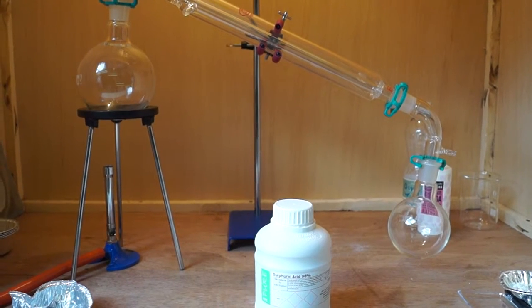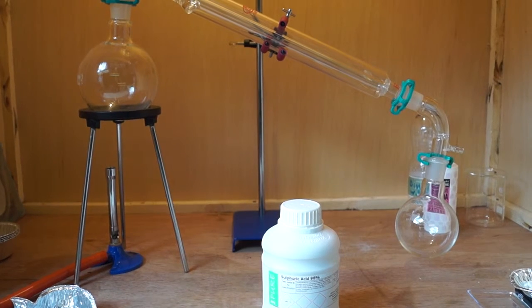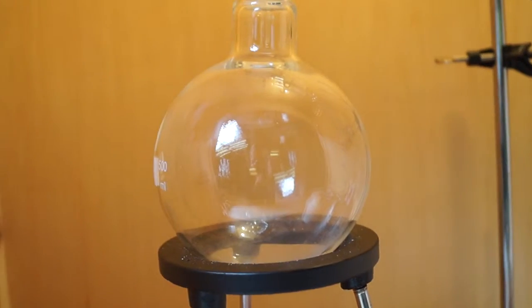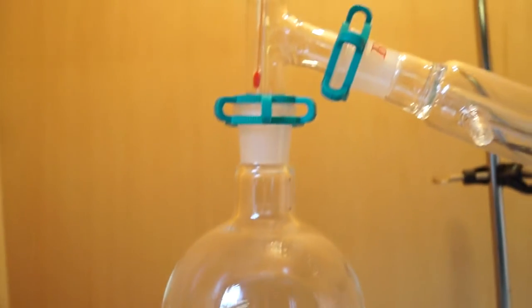Hello, and in today's video I will be showing you part 2 of the synthesis of glacial acetic acid tutorial. For this tutorial you will need some kind of distillation apparatus.